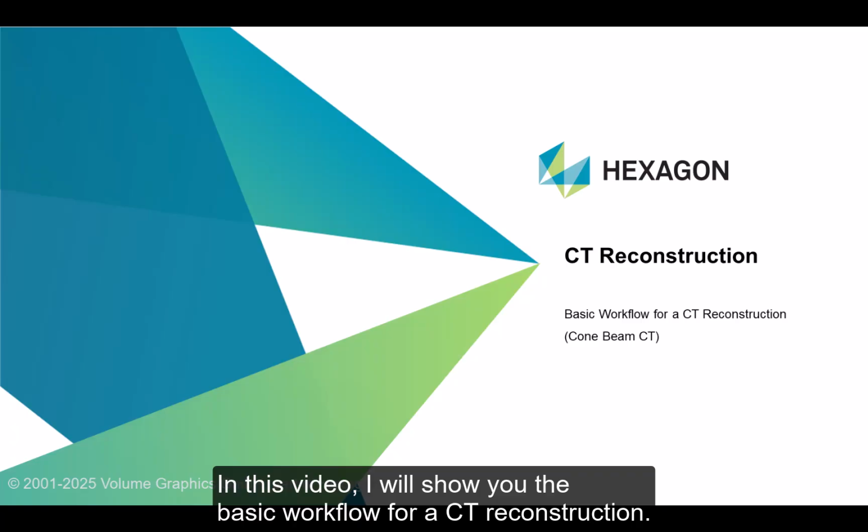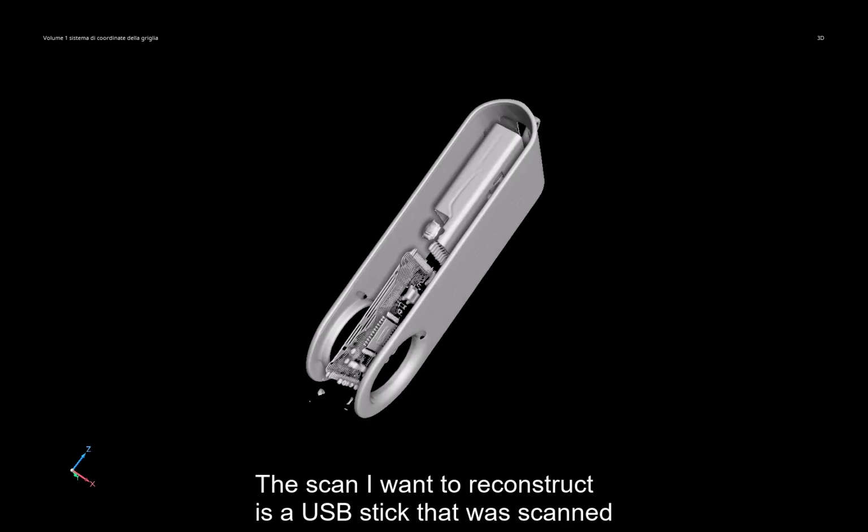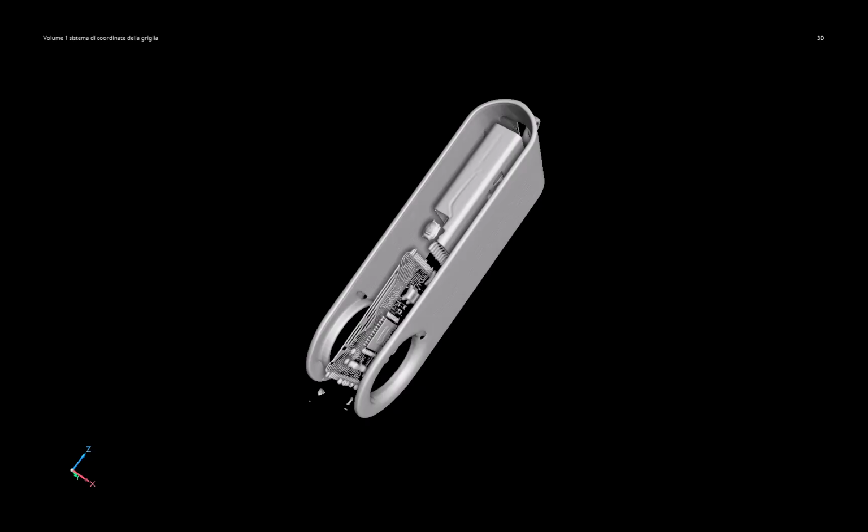In this video, I will show you the basic workflow for a CT reconstruction. The scan I want to reconstruct is a USB stick that was scanned in a cone beam scanner setup. First, I will open VGSTUDIO MAX.